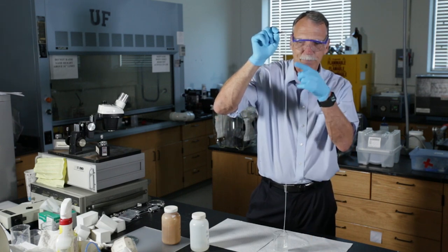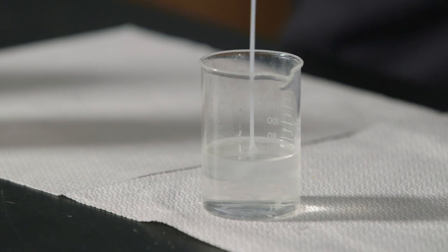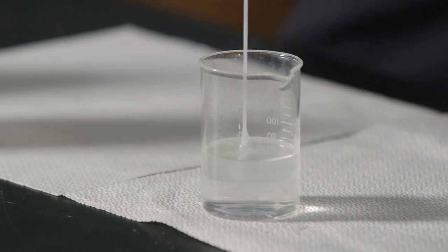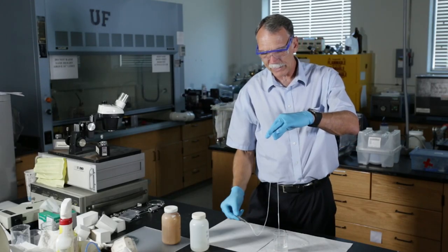So this is the long chain polymer that's being synthesized from these two chemicals. And this is actually one of the methods that you can use to make a polymer.